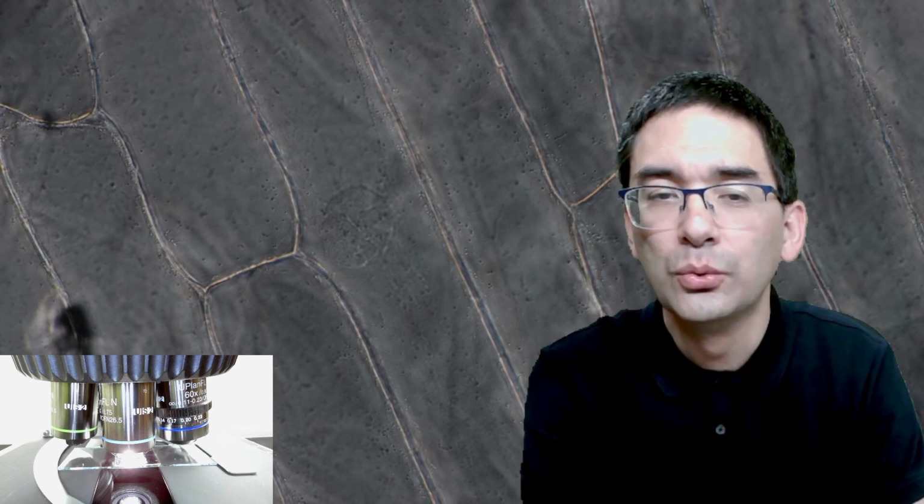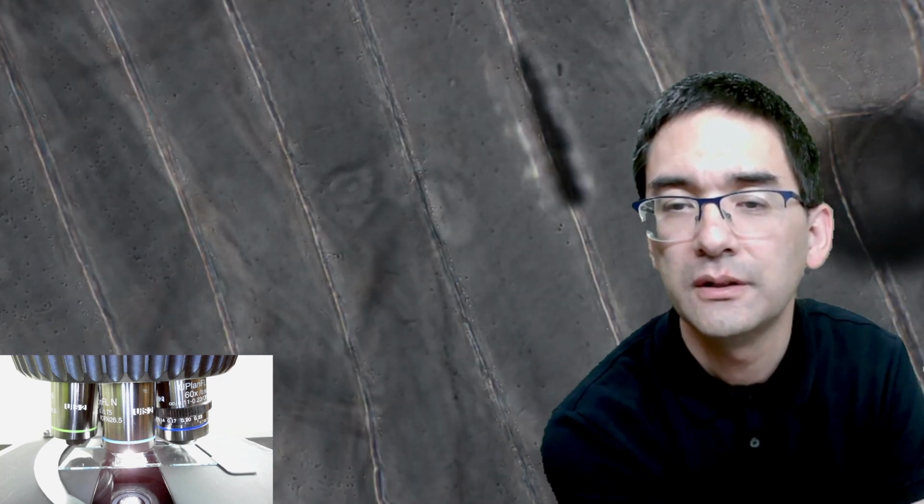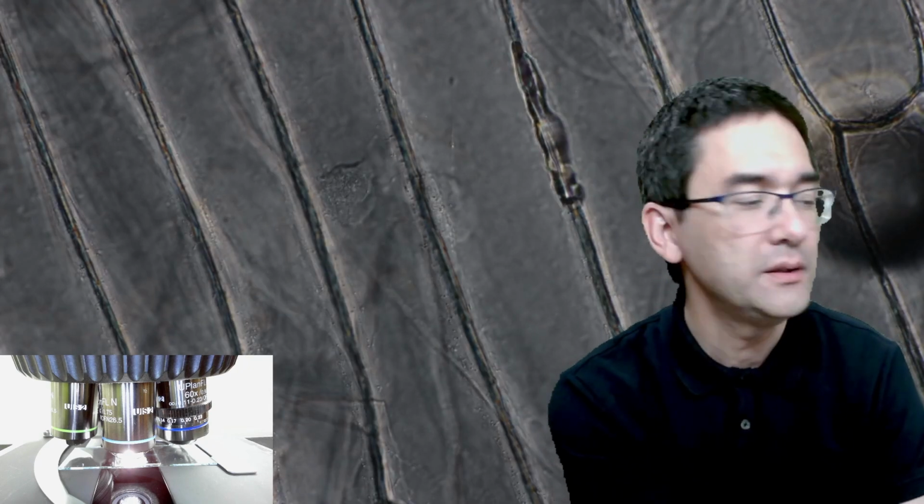Let me change the filter settings here a little bit as well. It's a little bit brighter. There are a whole bunch of things that I can adjust on my microscope. Maybe you're able to see this round structure right in the center. That's the nucleus. If you look around, you are able to see several of these. That's another one over here. There are two of them next to each other. So you see onion cells are quite nice to observe, because they're so easy to look at, but let's go down a little bit with the magnification again.